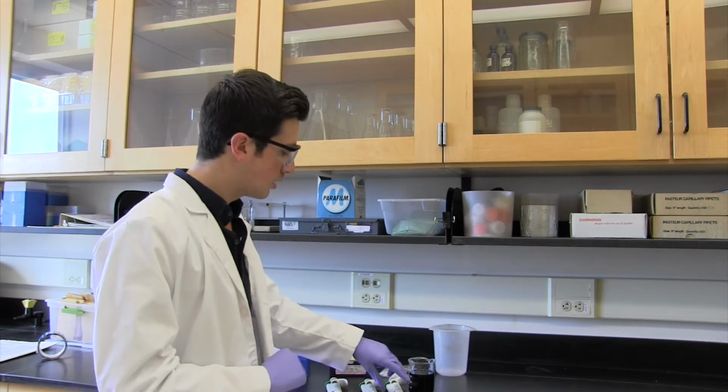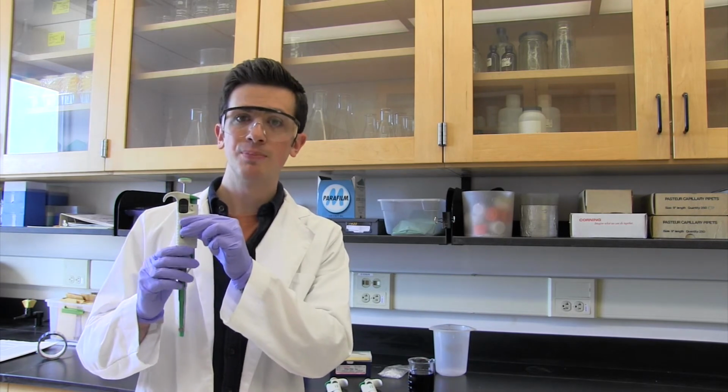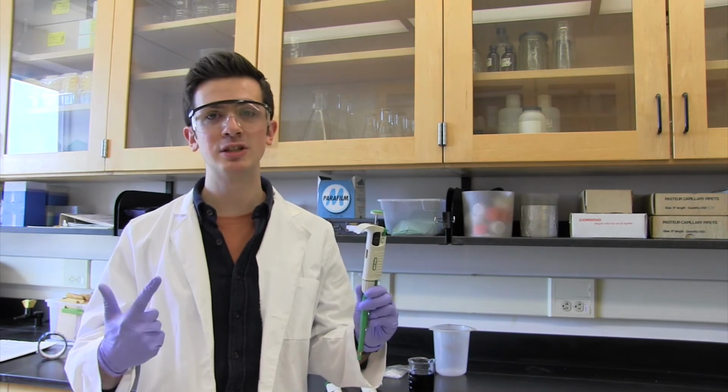We're just about done with our demonstration of the wonderful world of pipettes, so let's recap a few things. First of all, these pipettes are very delicate instruments. They've been calibrated to only work within a specific range, so make sure you stay within that range. If you're unsure what range your pipette is, check the plunger at the top of the pipette. Also, always make sure you're using the pipette vertically. Don't use it horizontally, laterally, or lay it on a lab bench if there's liquid in the pipette tip. All of these are great ways to either ruin your experiment or damage the pipette.